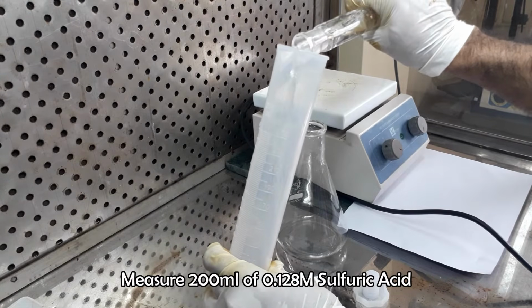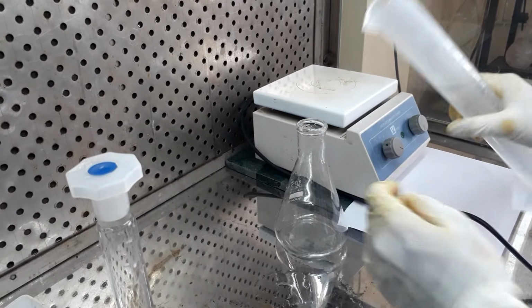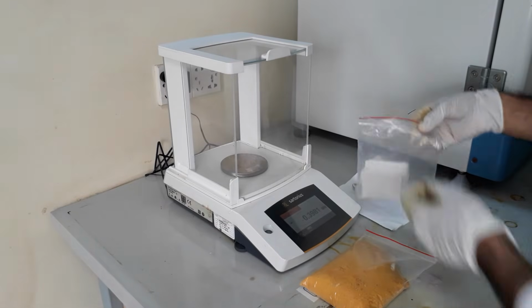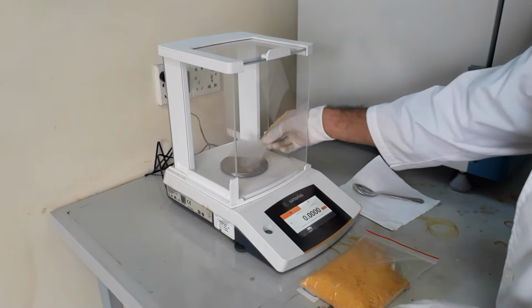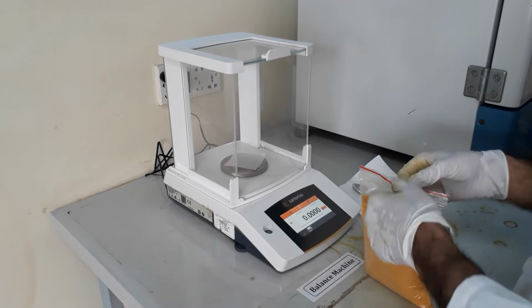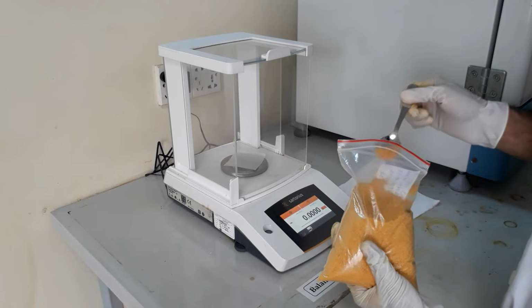Measure 200 milliliters of 0.128 molar sulfuric acid and pour into a 500 milliliters conical flask. Weigh approximately 2 grams of homogenized sample.